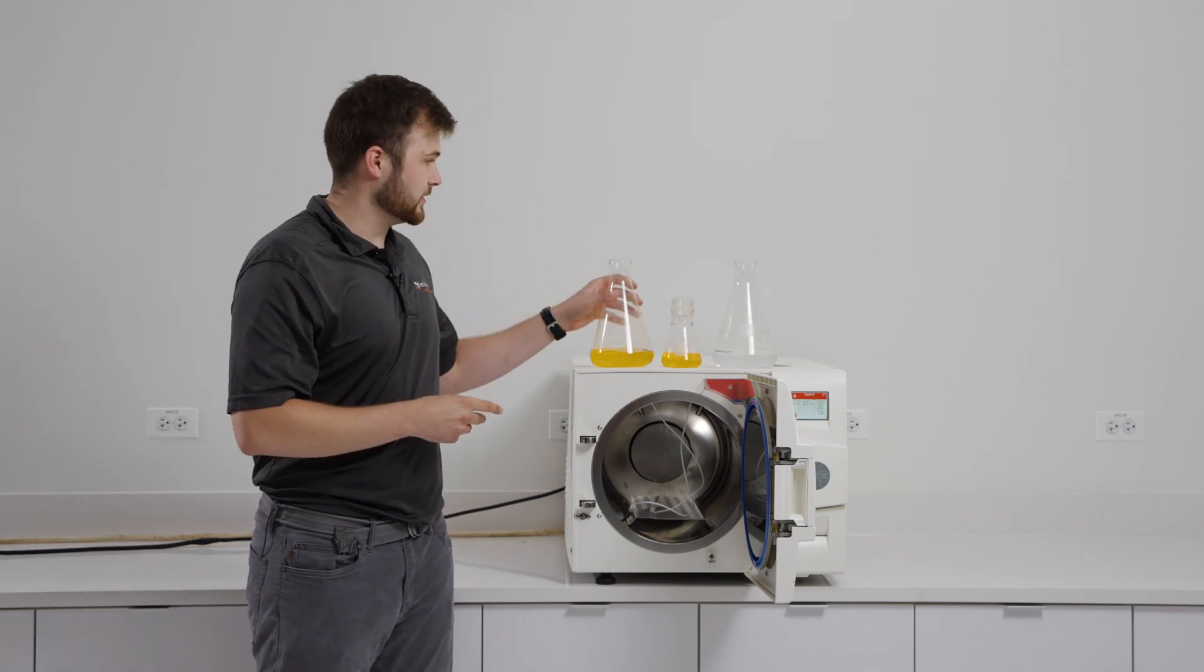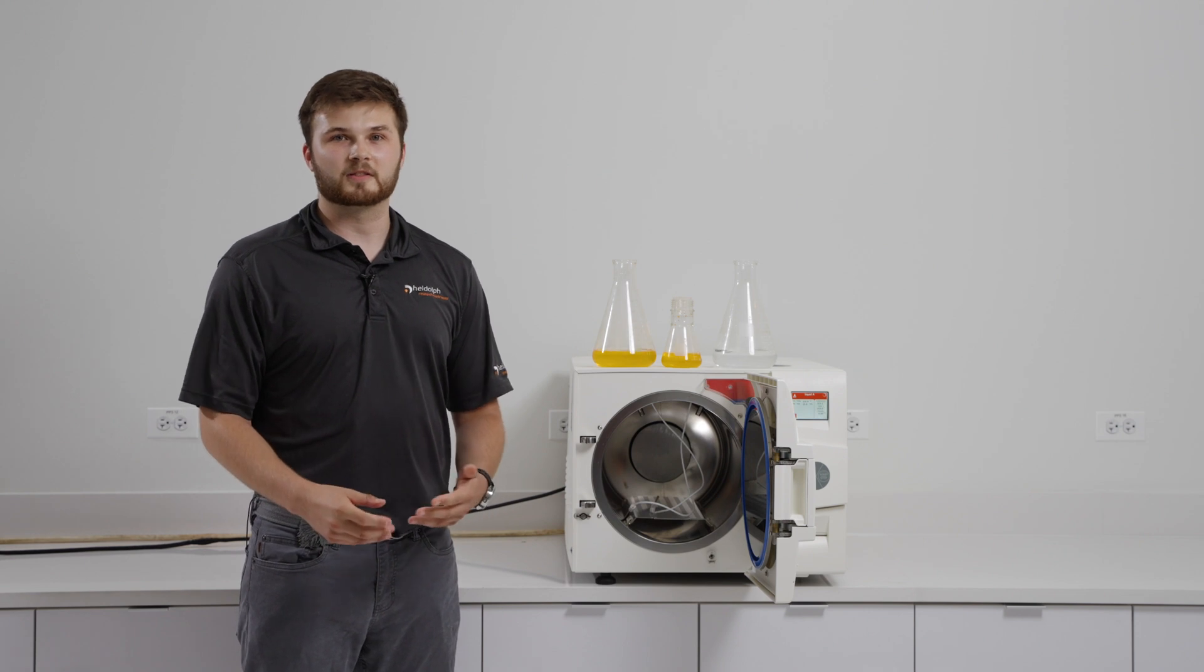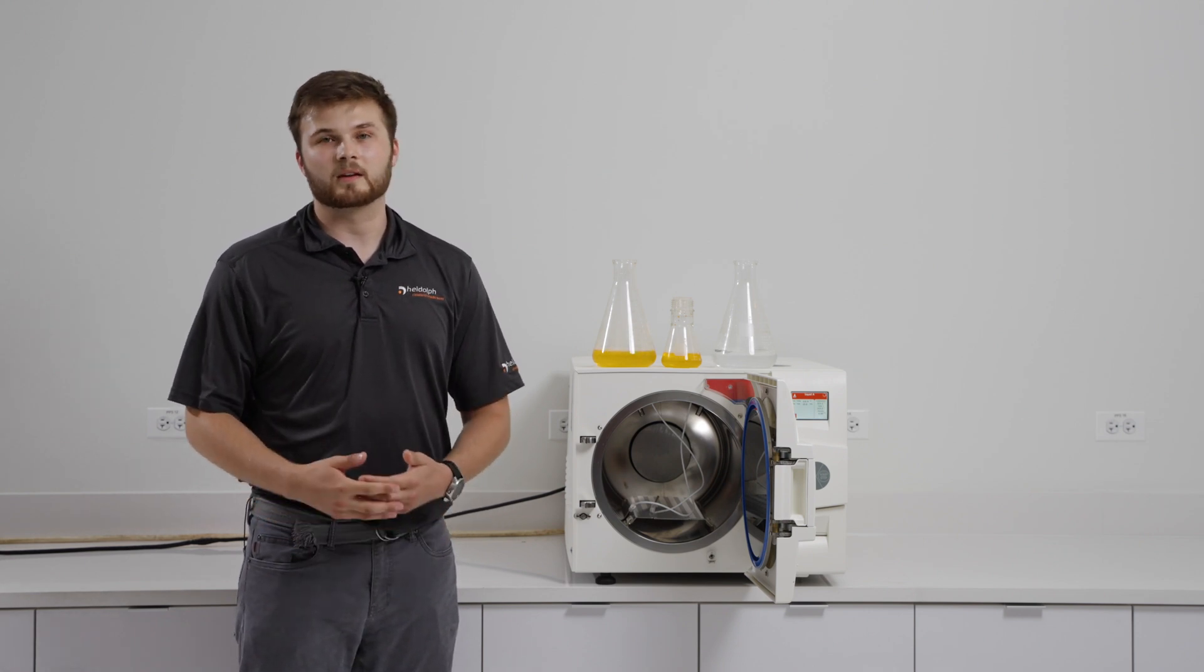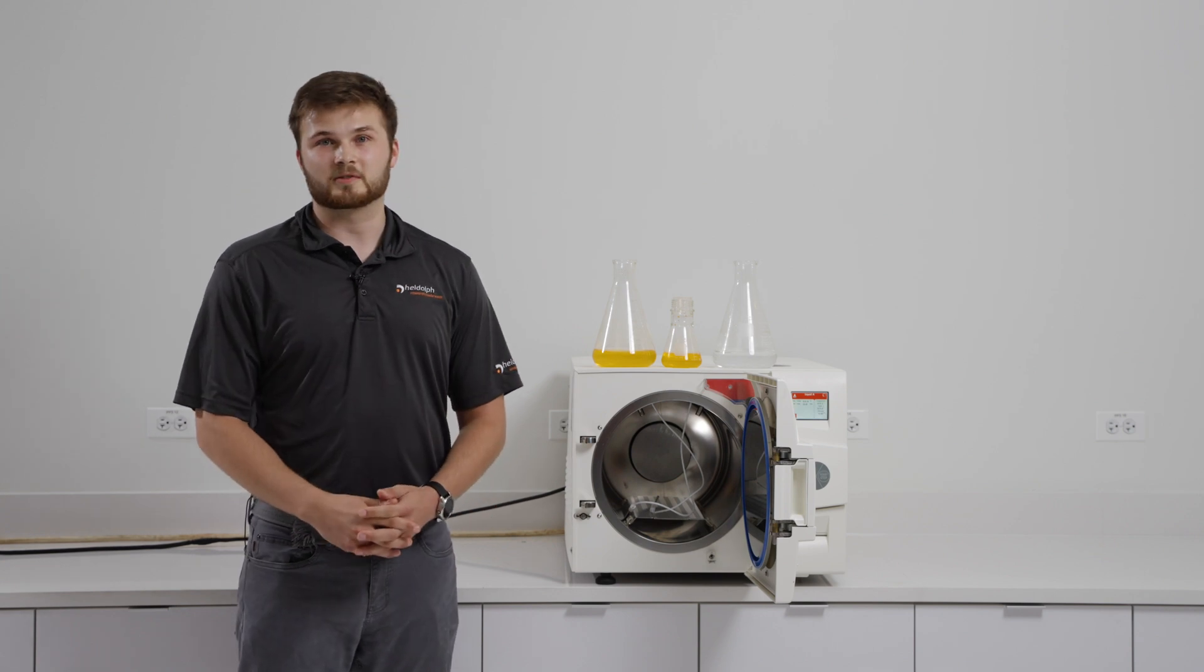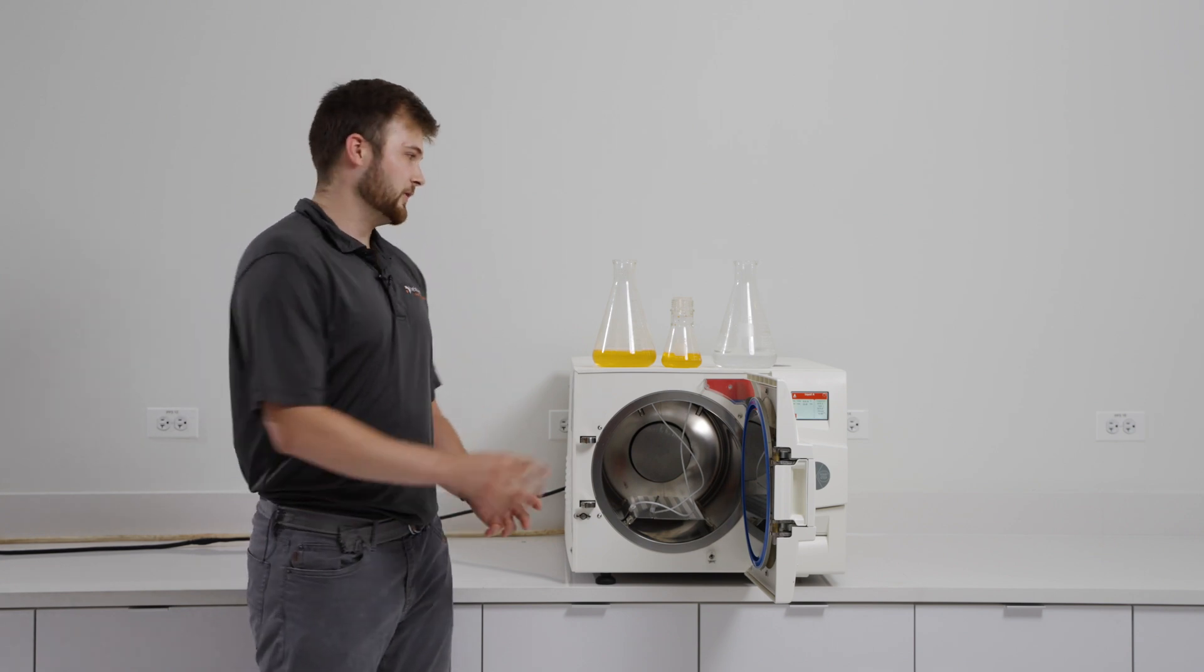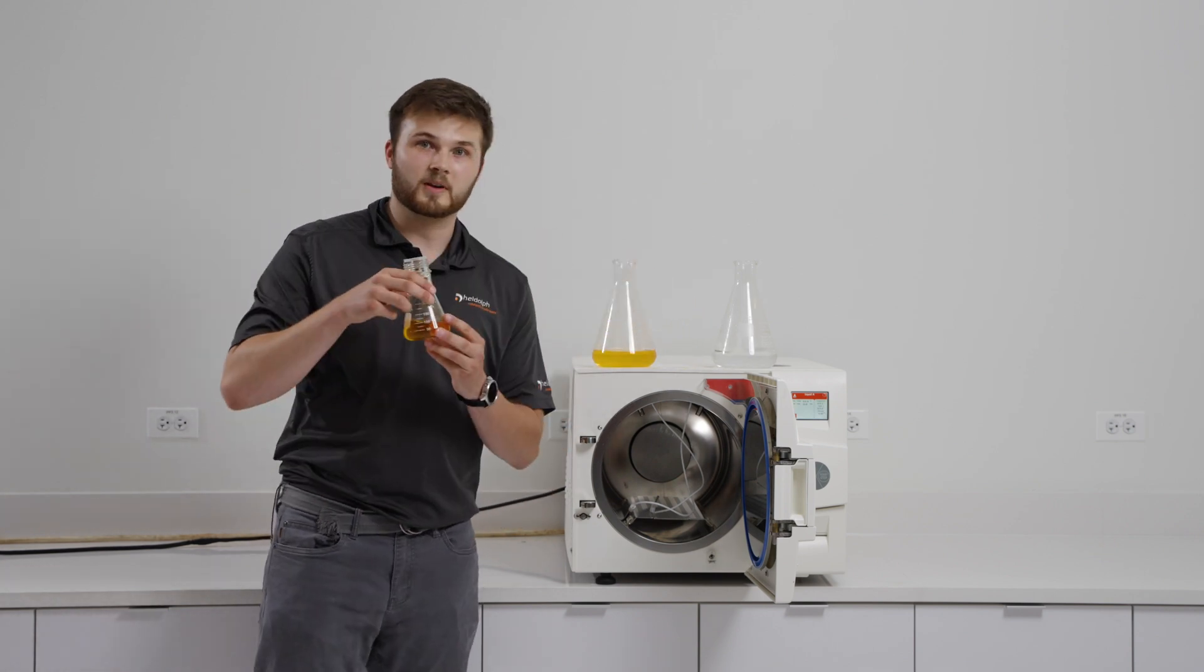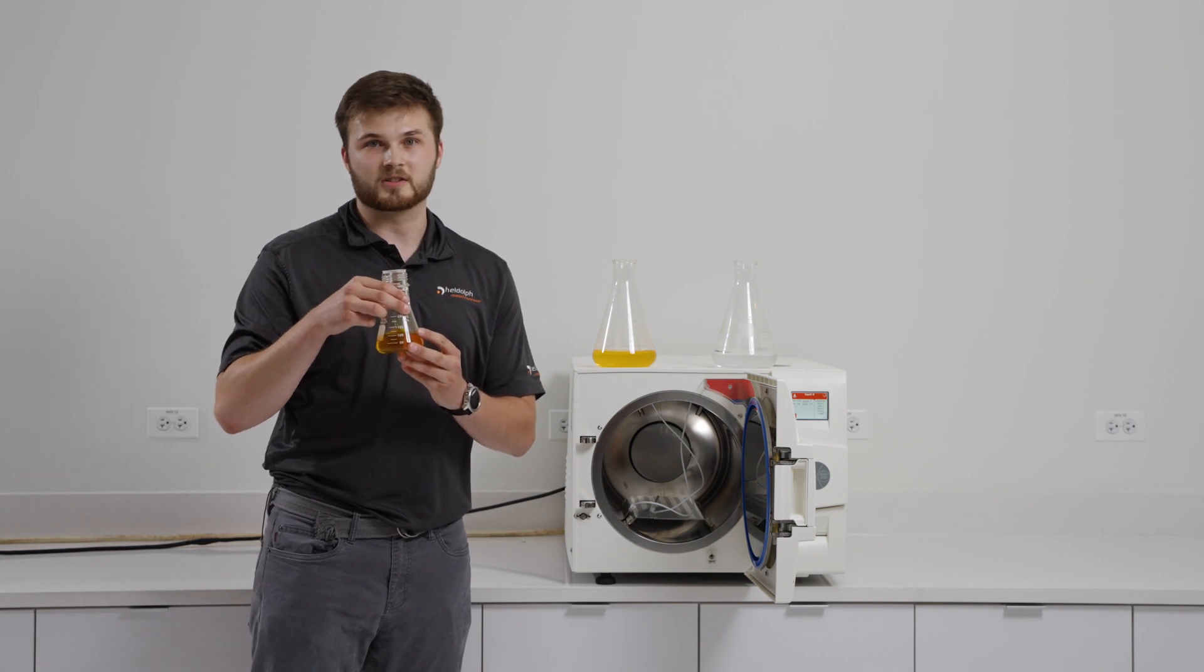This way, when I stick the probes in that control vessel, I'm monitoring the temperature of that larger volume and ensuring that the temperature of that large volume reaches the proper sterilization temperature, which therefore would mean this smaller volume has also reached that sterilization temperature.